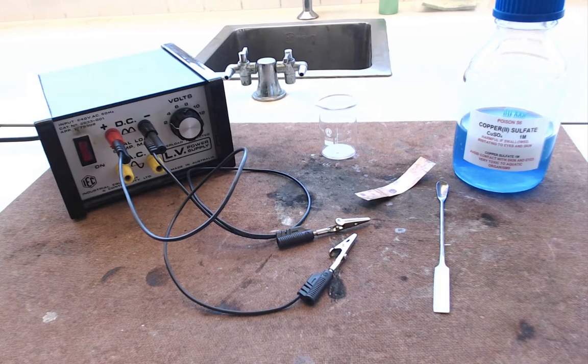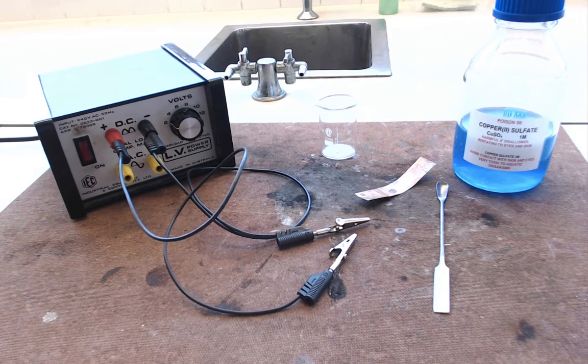Hello and welcome to this film which is all about the electrolysis practical that you'll be doing in class. Now it's quite a simple experiment, it won't take a huge amount of time.